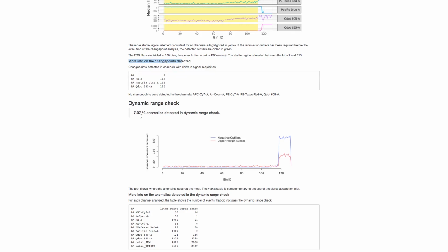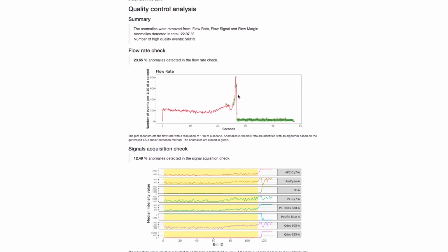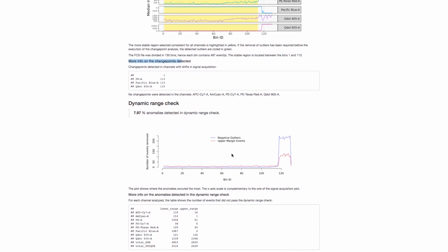The dynamic range check isn't as immediately obvious in terms of interpreting which data points are being removed from the analysis. Unlike the signal acquisition check, which really shows you just your data over time and channels, and you can see the yellow, which is what Flow AI ends up passing, and the rest is rejected. And same here, you can see exactly what's rejected and passed. This plot only really tells you about, on average, where the events are being rejected or passed.